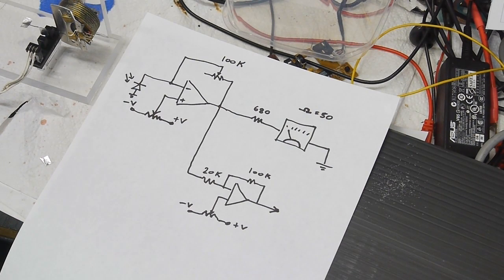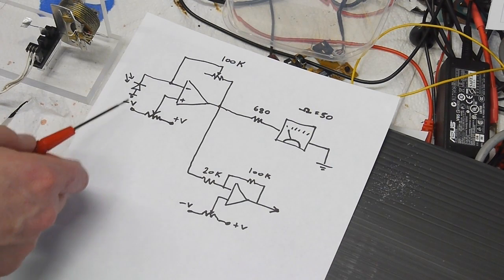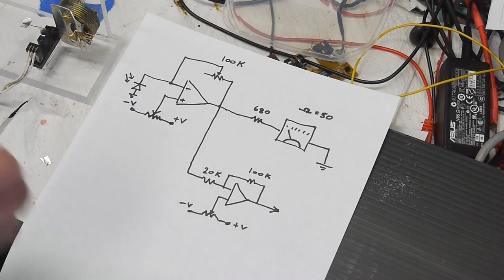What it actually needs is either a more gradual sensor here, so that we get some analog values before the thing suddenly cuts on or off, or more physical damping in the meter. But I couldn't figure out how to do damping without also affecting the accuracy of this thing. So for a quick little project, I didn't worry about it too much.